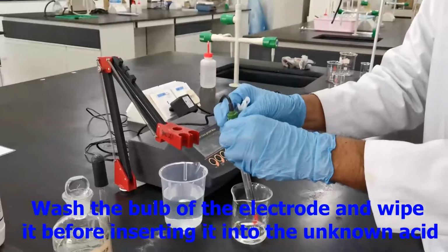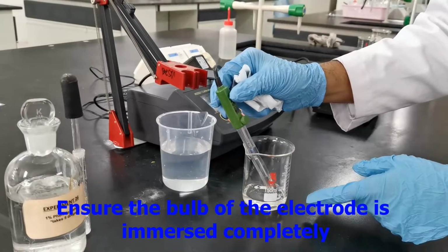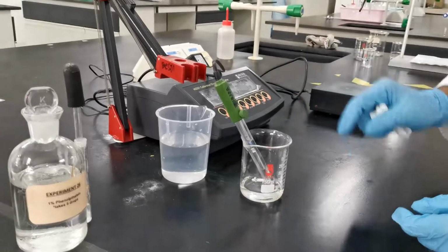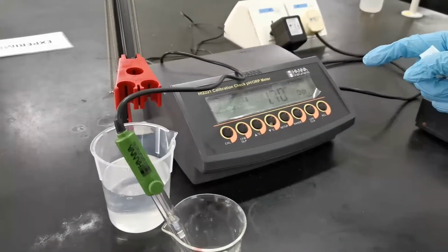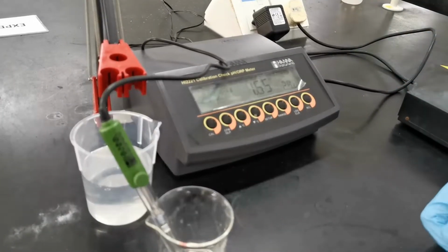Then you immerse it fully. Make sure the bulb is fully immersed in the liquid, and you need to wait until it gives a stable reading and then record it.